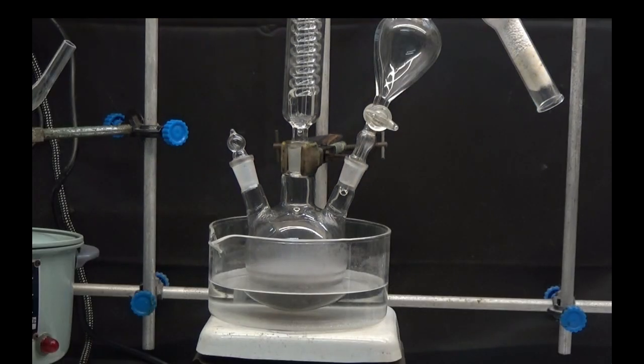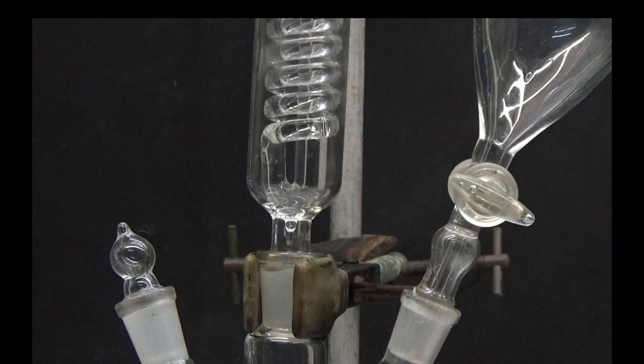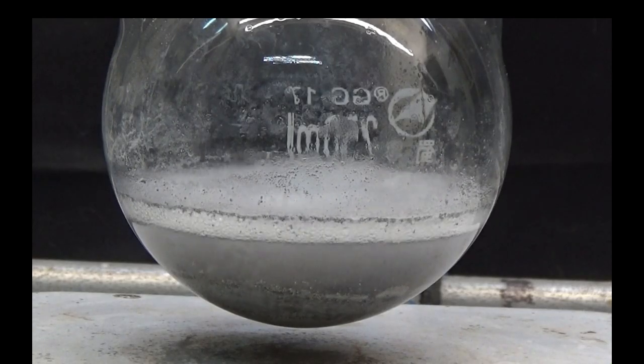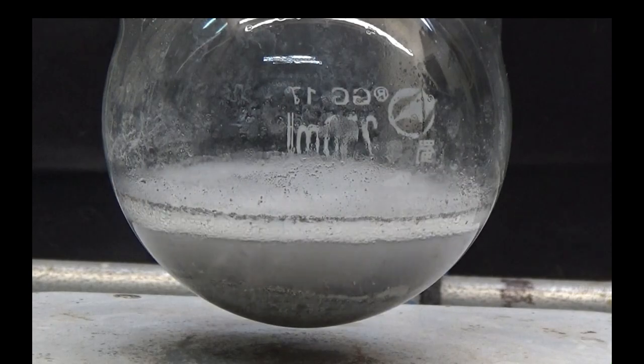After the addition of the diethylmalonate solution, heat in a water bath. After two hours, most of the magnesium has dissolved.